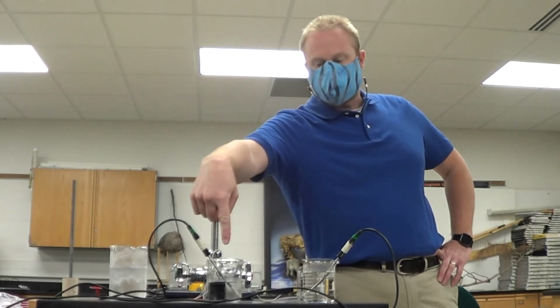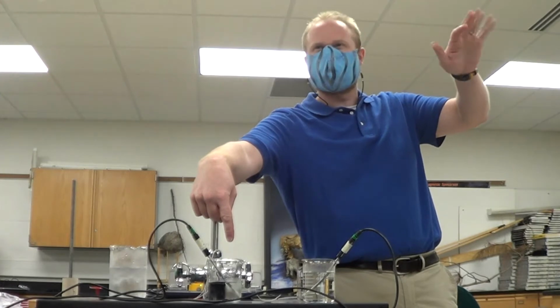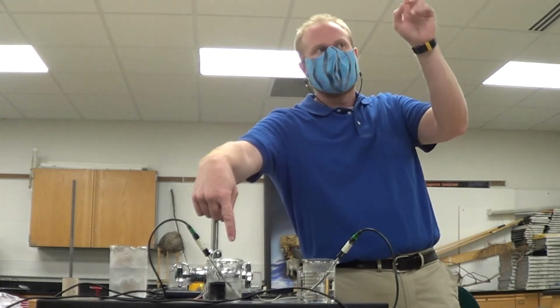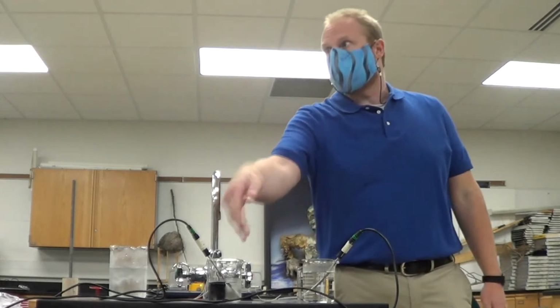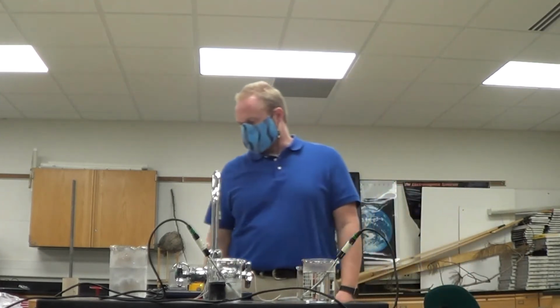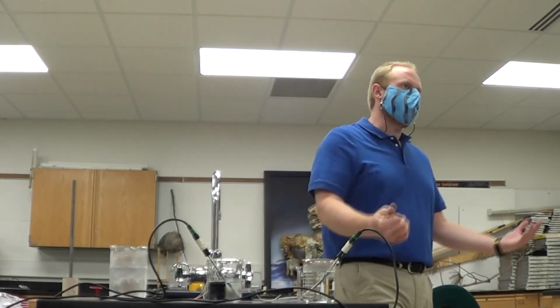Okay, so the 100 grams of hot metal went from about 6.4 degrees up to like 7.6. So it went up about 1 degree. But when I added 100 grams of hot water, both 100 grams equal mass, the hot water one went up to 37. Okay, so I see 37 for my hot water, and I see 8 for my hot metal.